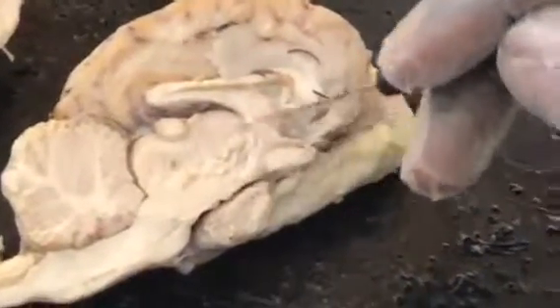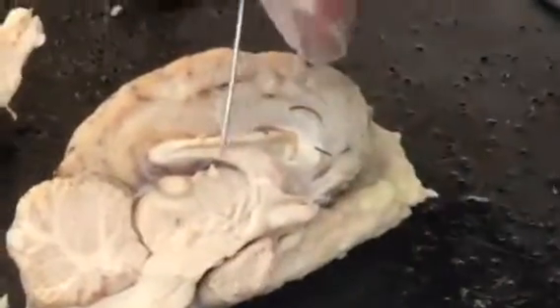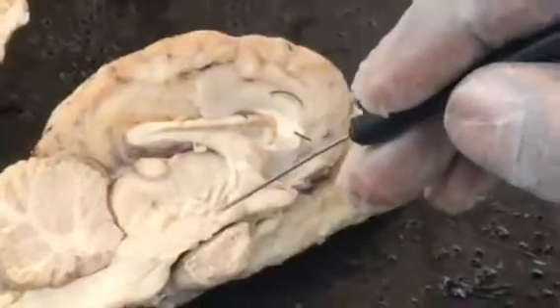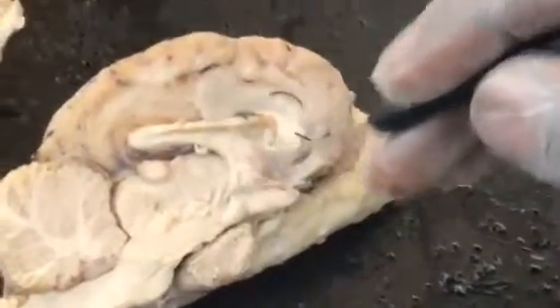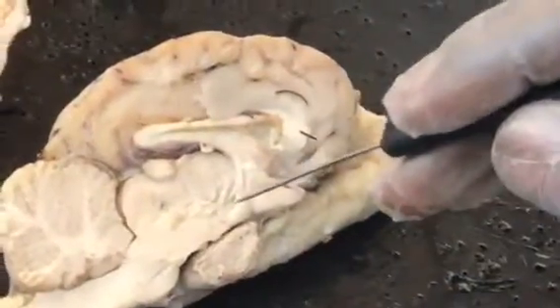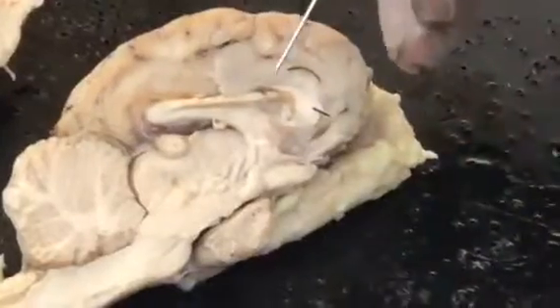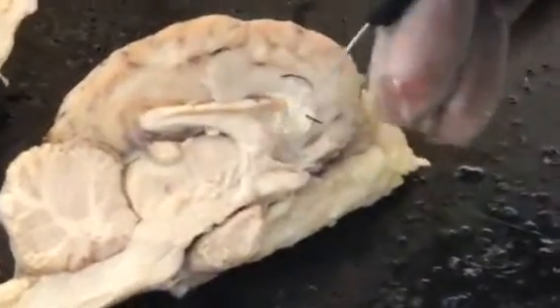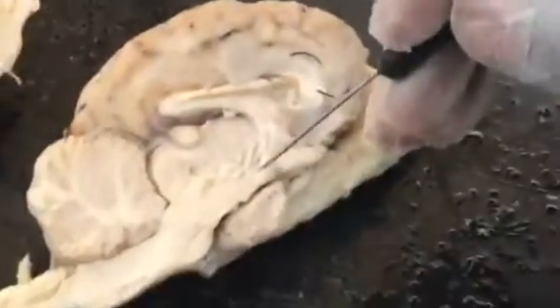This part here is your midbrain. From your midbrain, you have your thalamus. Directly below your thalamus, you should have your hypothalamus in here. And then thalamus, hypothalamus. In here, it looks like your pineal gland is up here. This is your pineal gland. Now, if this is your thalamus, hypothalamus, your third ventricle should be around in here.